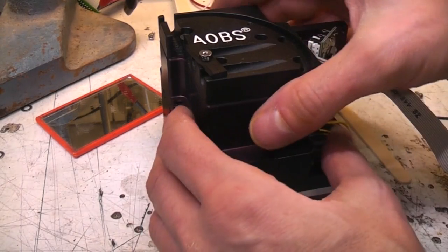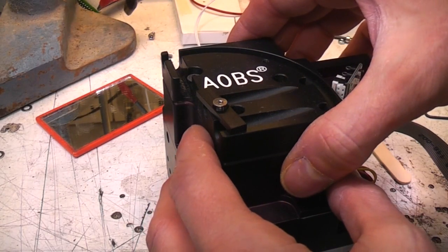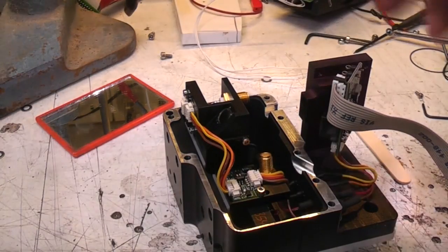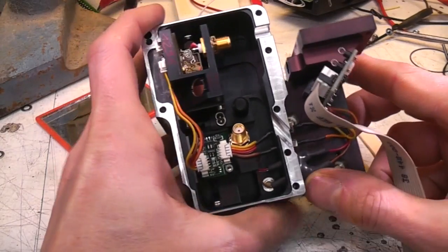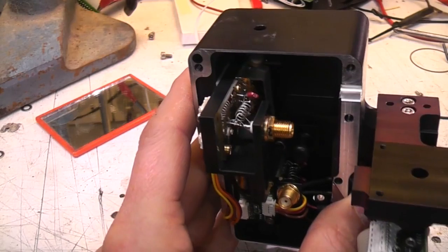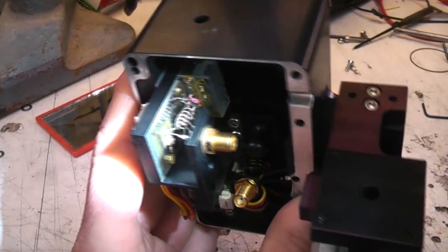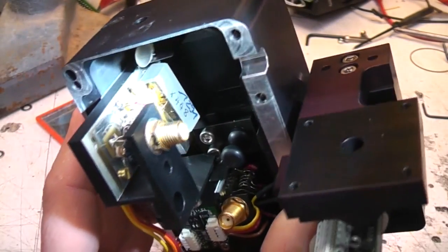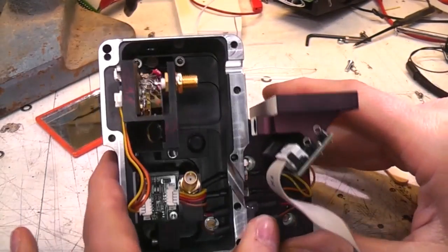And the final part of the puzzle, this is the acousto-optical beam splitter module, where all the magic happens. And there's a couple of acousto-optical parts here. There's this one at the top, and you can see there's the RF input there goes through a coil. That's probably a matching network onto the side of the magic crystal, and the beam path on here.